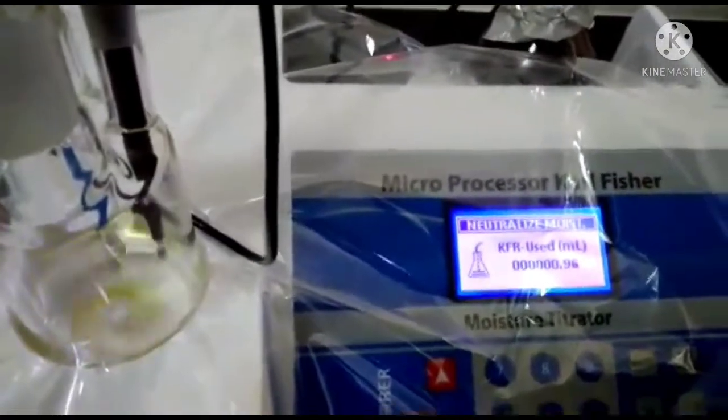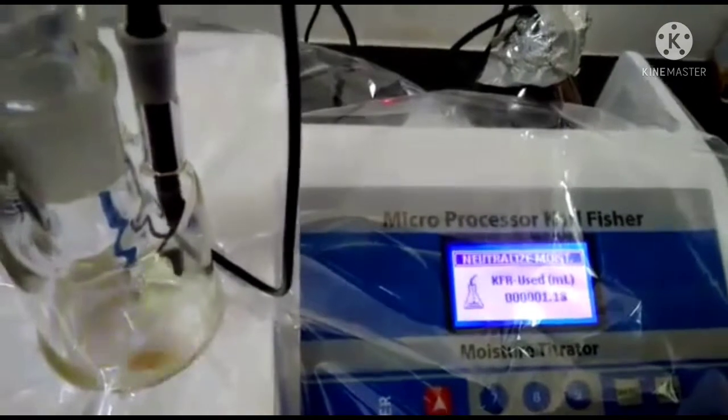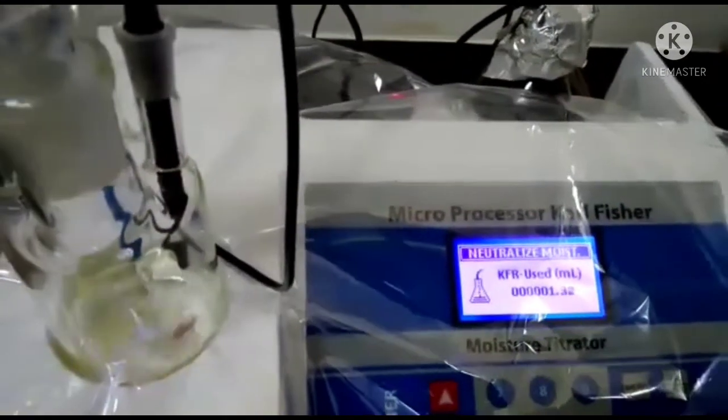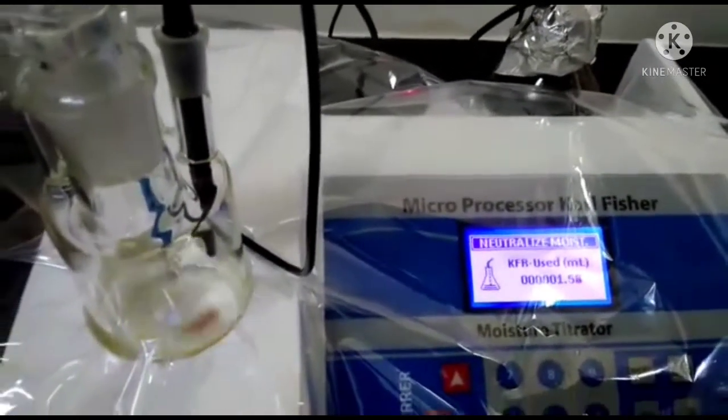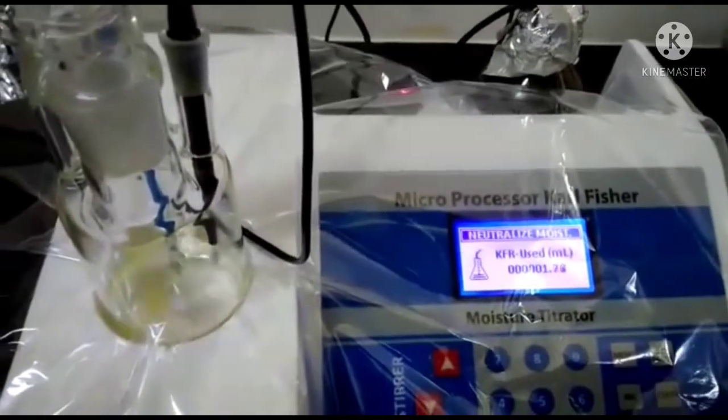Till the end point we have to wait. So this is the first process that we have to do, the neutralization process.